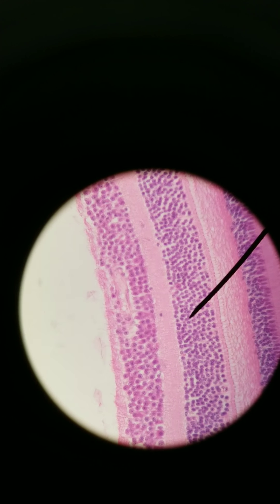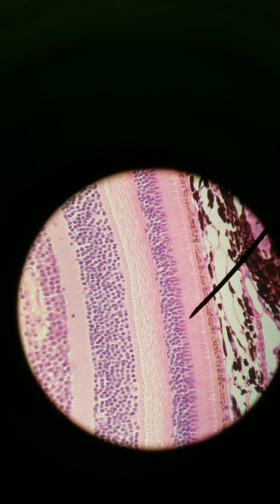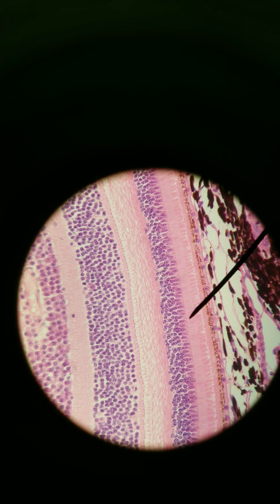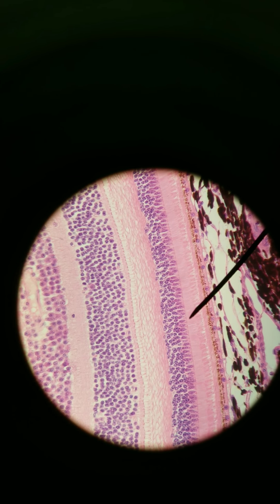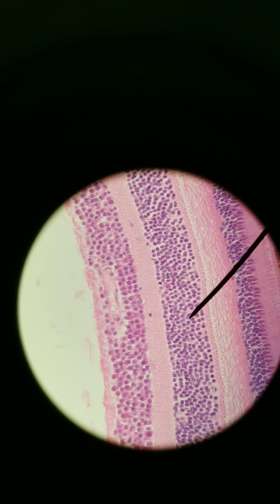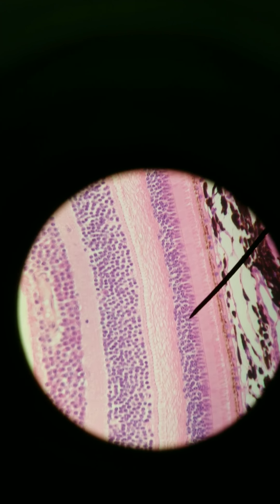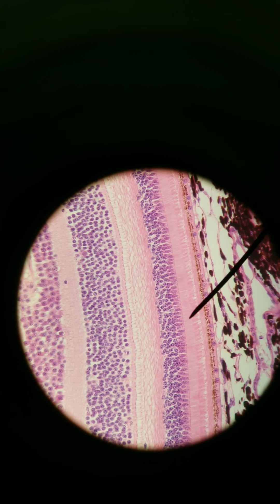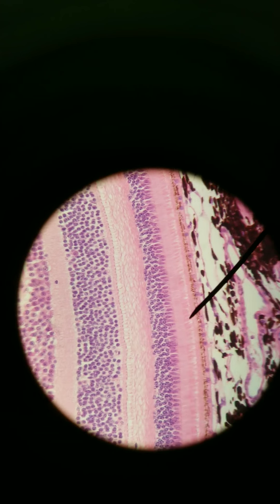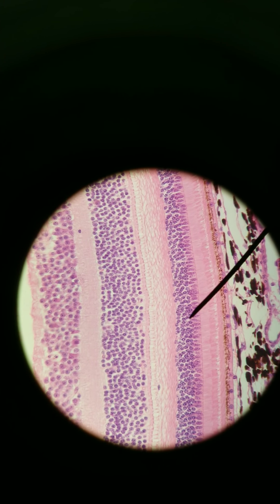Let's go closer — let's go to 400x. Photoreceptors are unlike those olfactory neurons because these photoreceptors are not neurons. They're special receptor cells. They are neuroepithelium — modified special epithelium. And when they get activated by light, they send a signal to the neuron next to it. That's why they're called neuroepithelium. This layer of cells right here, you can see the nuclei of them. These areas are also part of their cells — they're part of the rods and cones. These are the photoreceptor cells. They are not neurons, but they communicate with neurons.